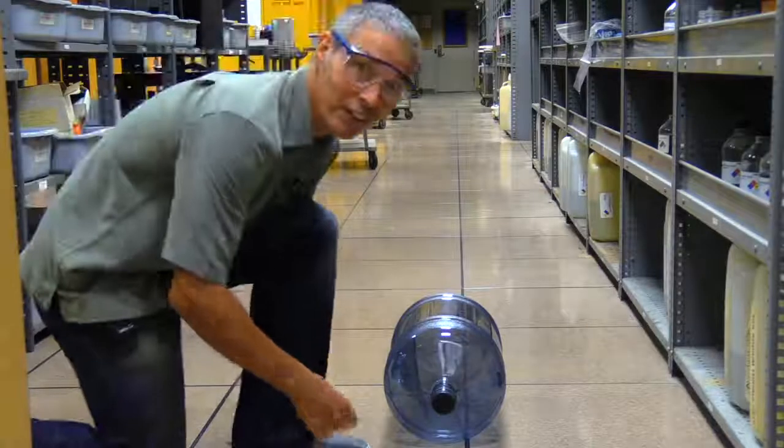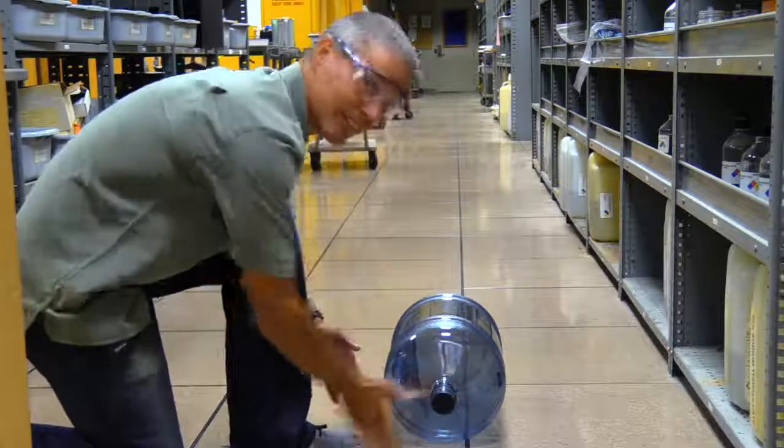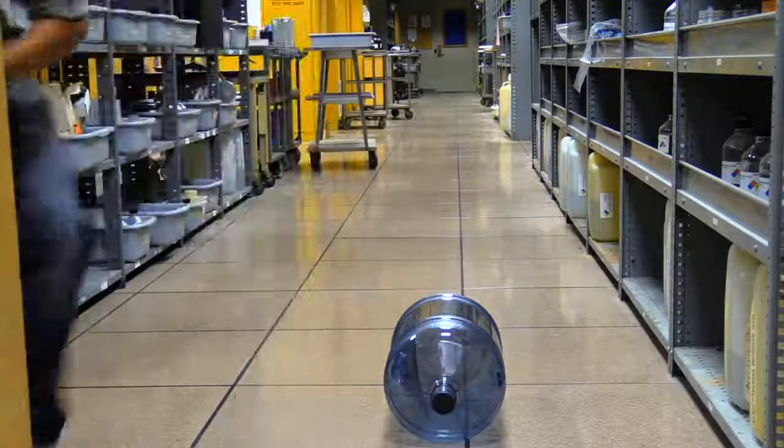This is the prep room. Each of these tiles is two feet long, so we'll make this the start line. See how far 1-propanol goes - here we go!